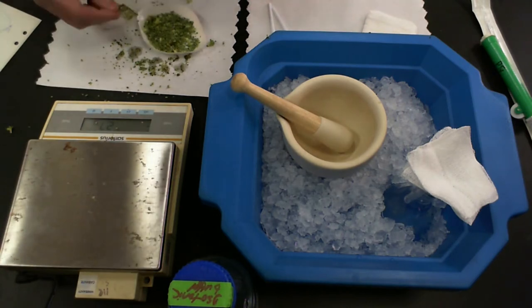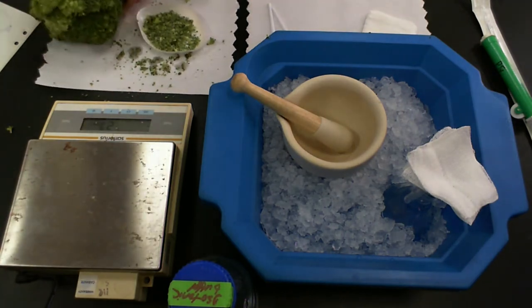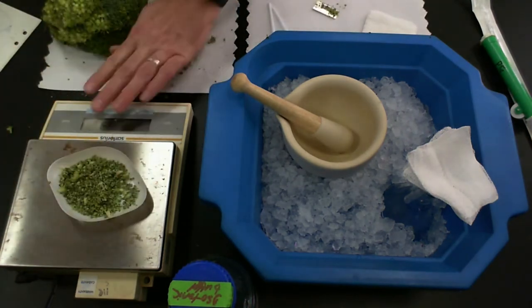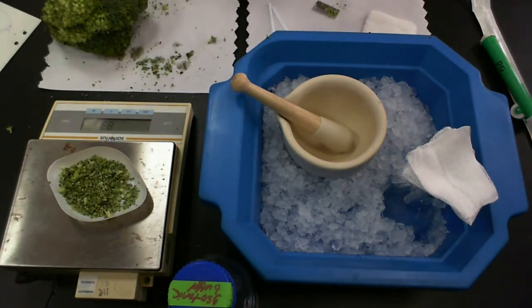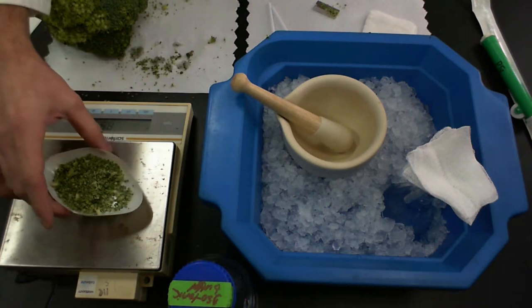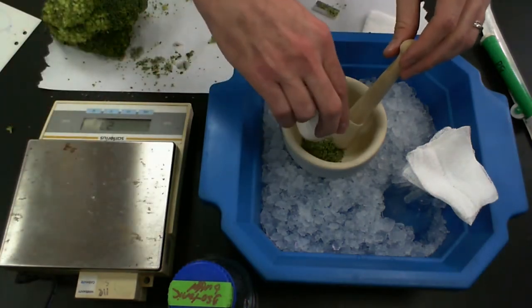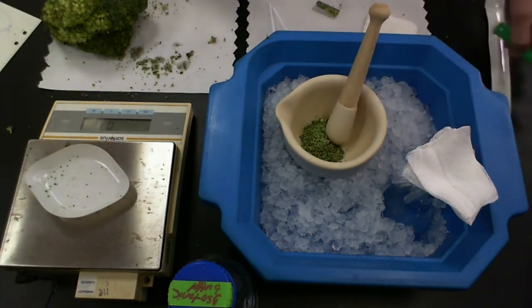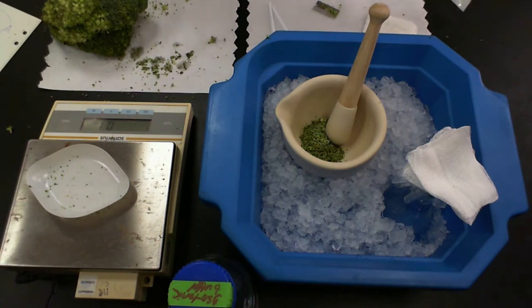So that's what I've got here. So here's my weigh boat. I'm going to place that on here. I've got about eight grams. So I'm going to put that into my cold mortar and pestle. Cold mortar.